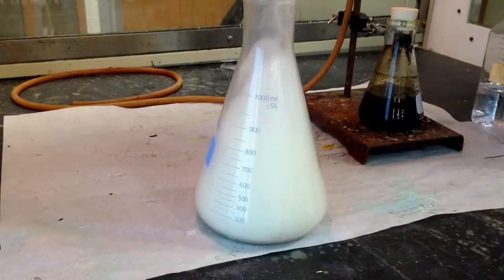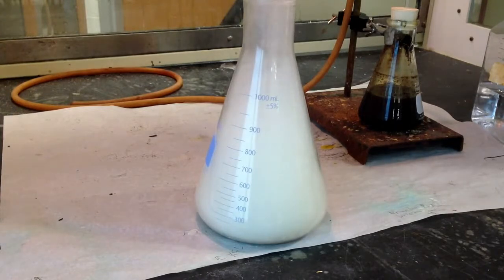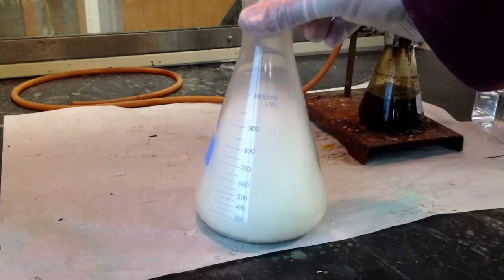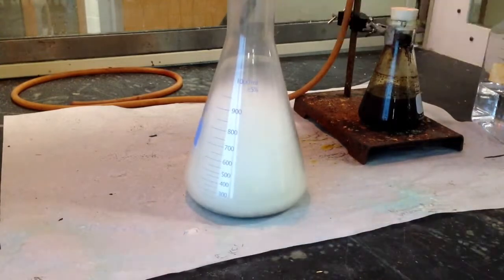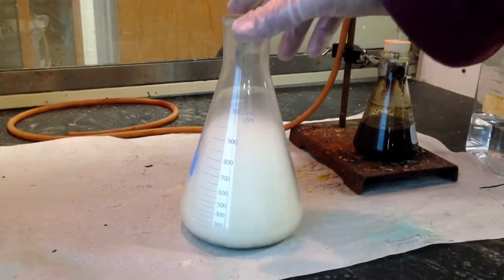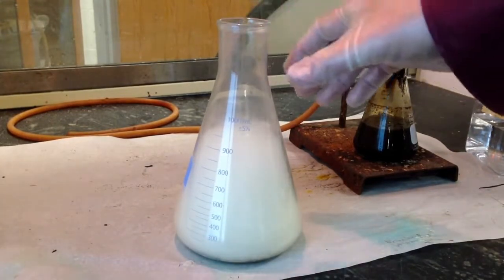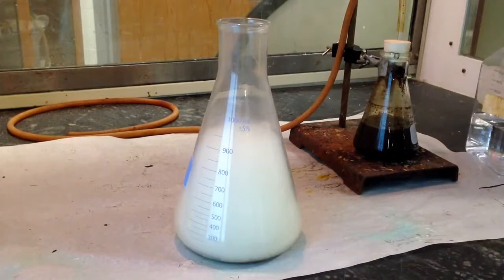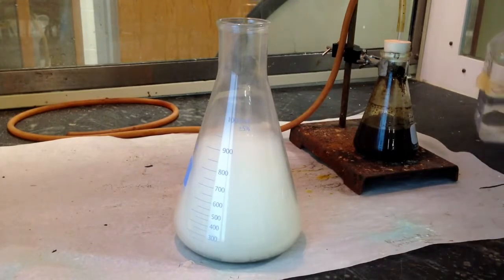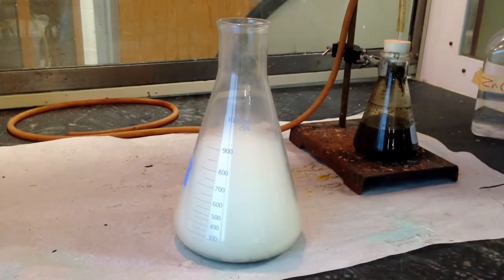And that white smoke you see is sodium chloride solid. It's a colloid. And so that white smoke is the presence of sodium chloride that we made. And as it dissipates, we'll see where the sodium was. And where the sodium metal was is now going to be a crystal lattice of sodium chloride. Notice the color of the flame was indicative of how sodium metal or sodium electrons get excited and emit energy.